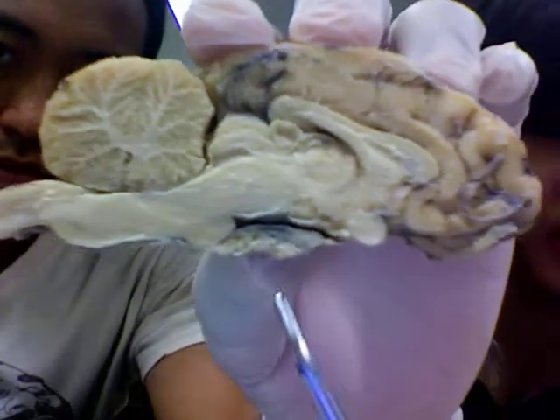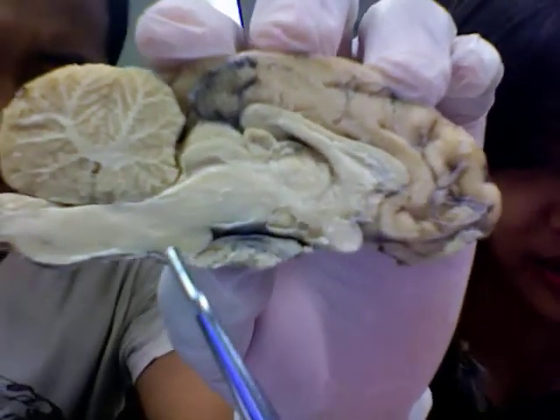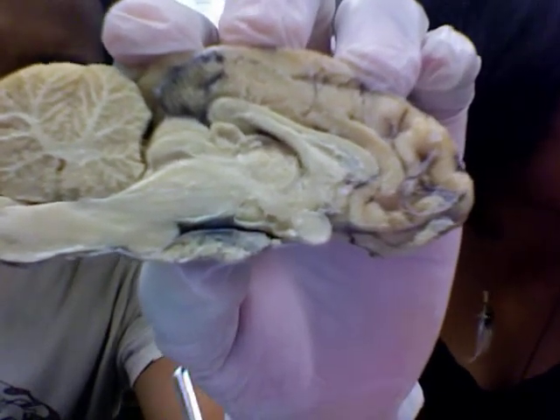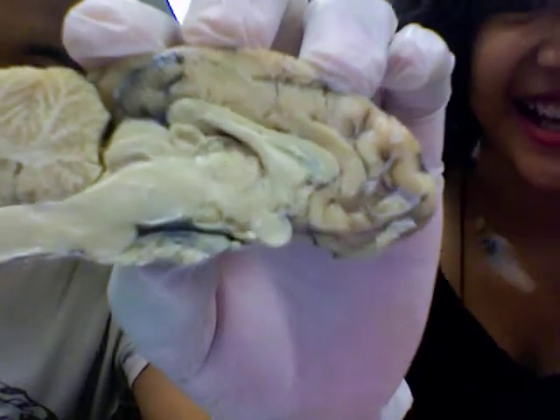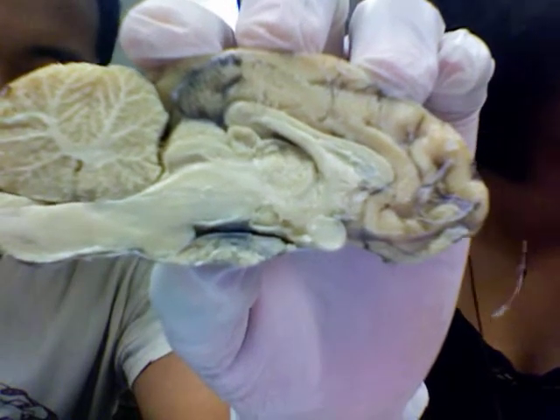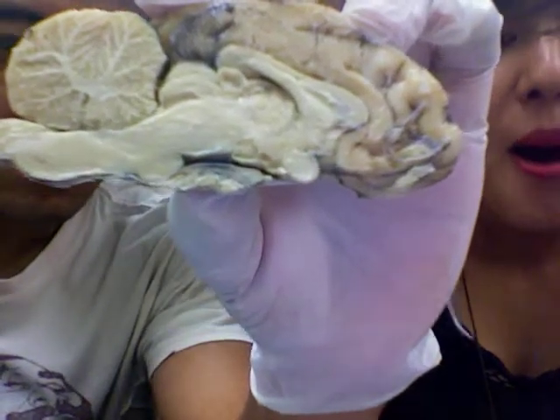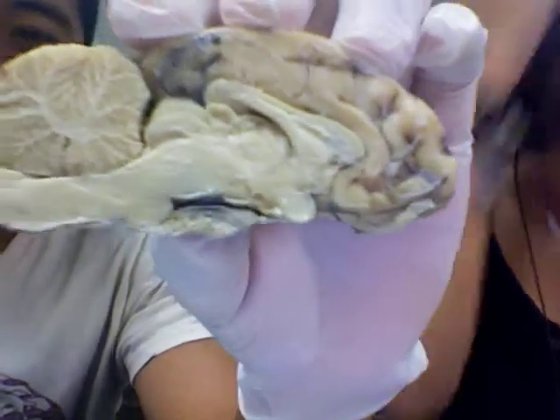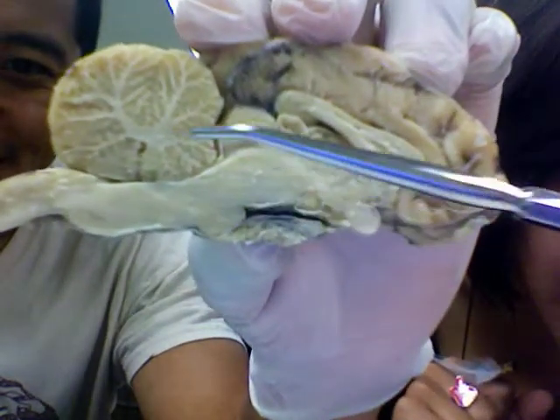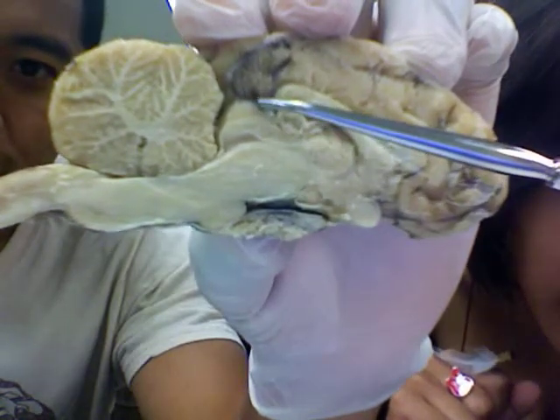This thing right here is the inferior colliculus. Is the C silent? I don't think so — there's a C at the end. Oh, look, the first one he misspelled. So colliculus — inferior colliculus and superior colliculus.